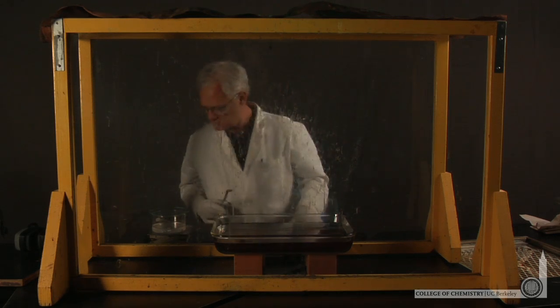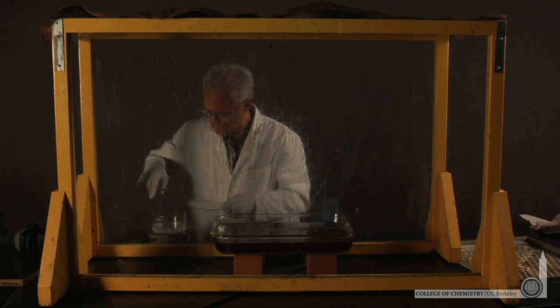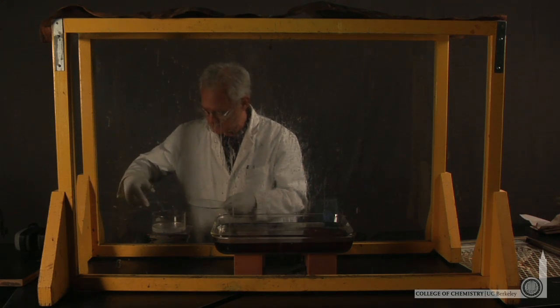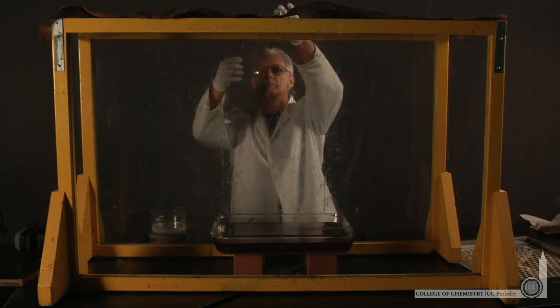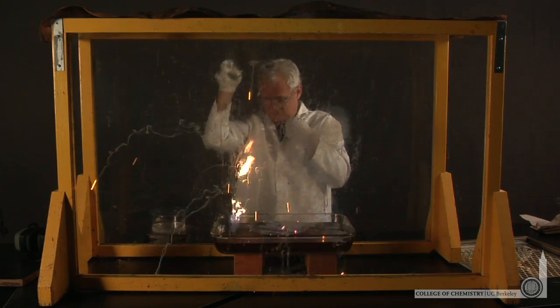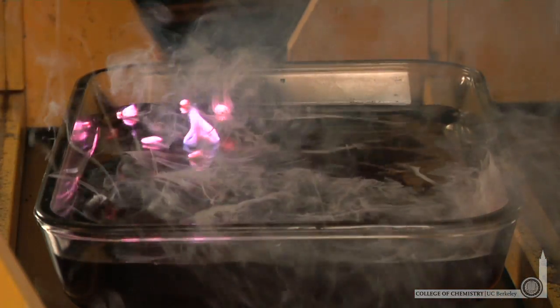If we go one element down the periodic table to rubidium, with a lower ionization energy, we should see more of the energy that's released when water is reduced for the rubidium metal. And indeed, that reaction happened so quickly, we should watch it again in slow motion.